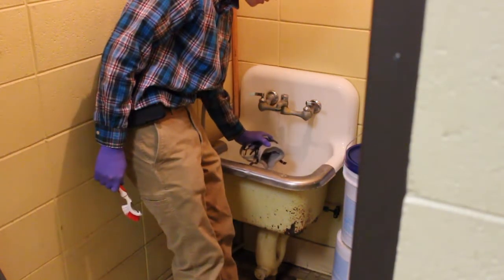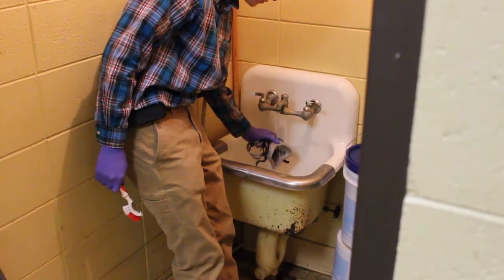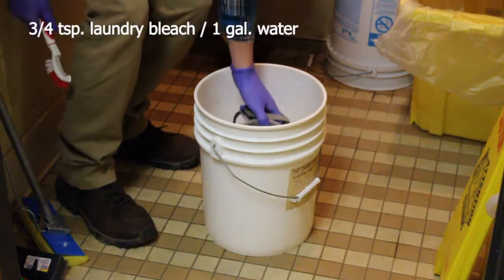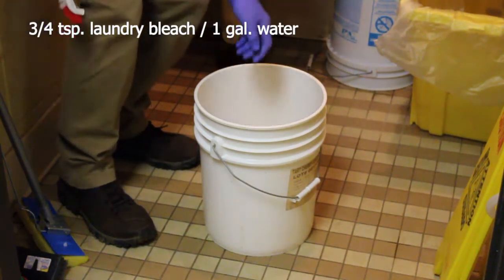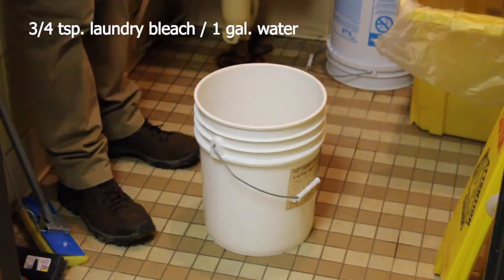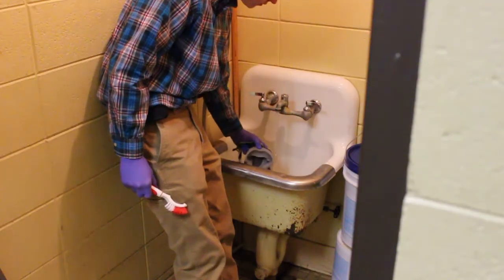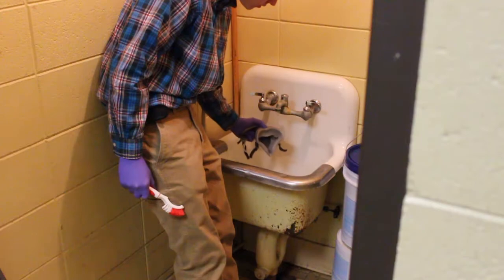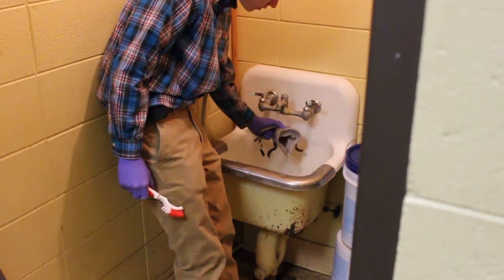Rinse components thoroughly in clean running water and drain. Respirator components should be immersed for 2 minutes in approximately 3/4 of a teaspoon of laundry bleach per gallon of water at 110 Fahrenheit. Rinse components thoroughly again in clean warm water. Drain. The importance of a thorough rinsing cannot be overemphasized.